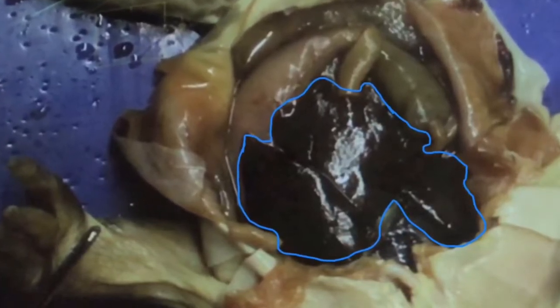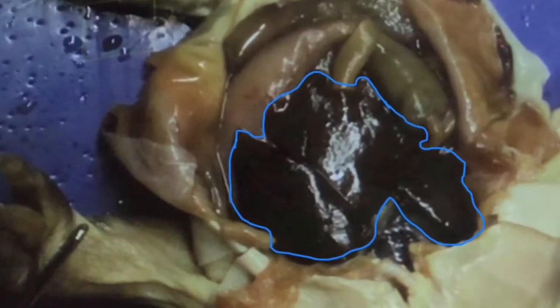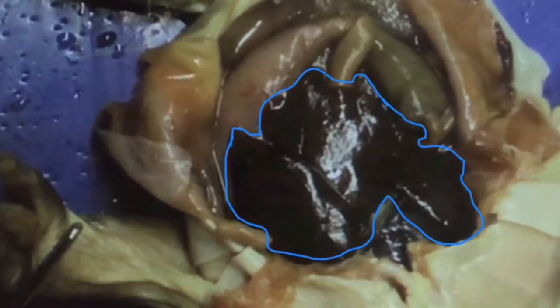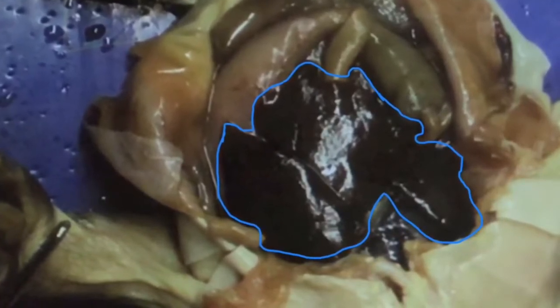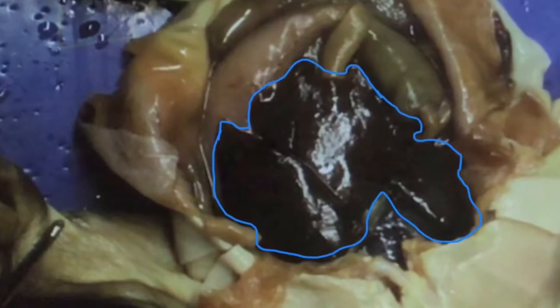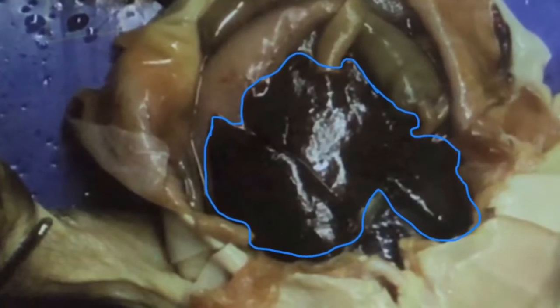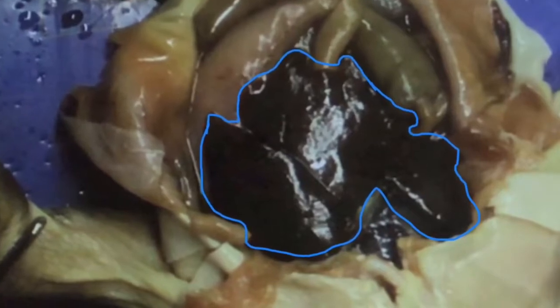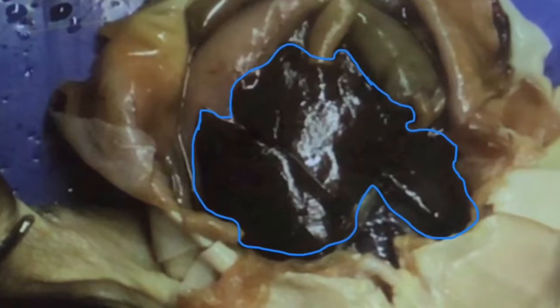For bile production, inside the small intestine, there is bile which helps break down and absorb fats and cholesterols. For fat metabolization, bile breaks down fats, which makes it easier for food to be digested. And for metabolizing carbohydrates, inside the liver, carbohydrates break down into glucose and get into the bloodstream to maintain normal glucose level. They're stored as glycogen and release quick bursts of energy when needed.